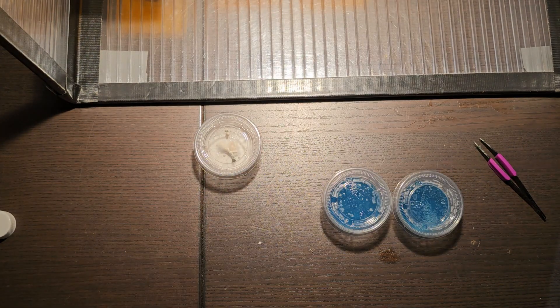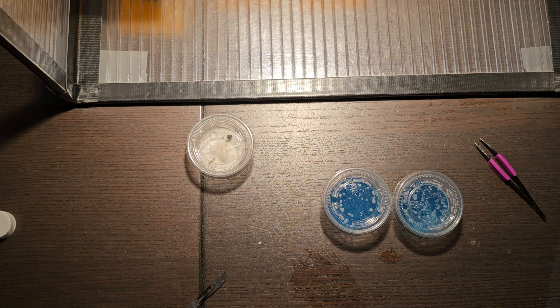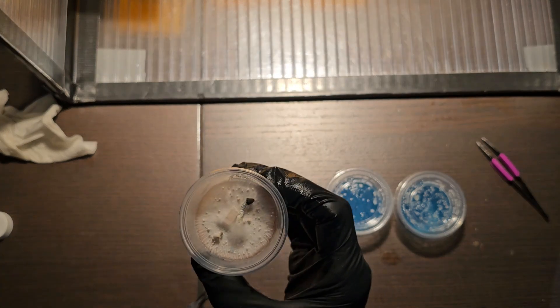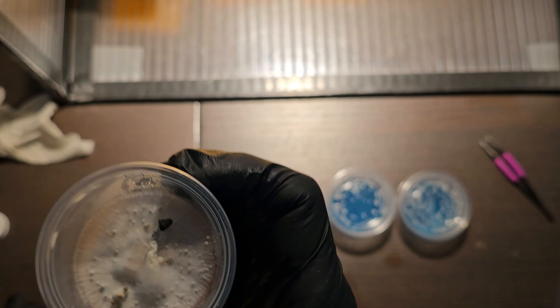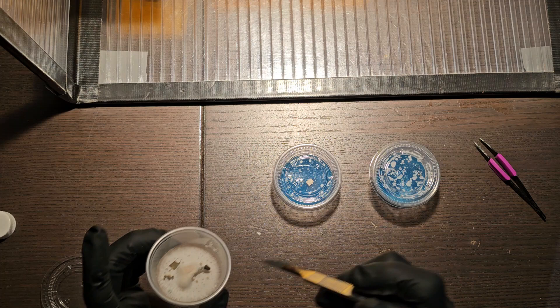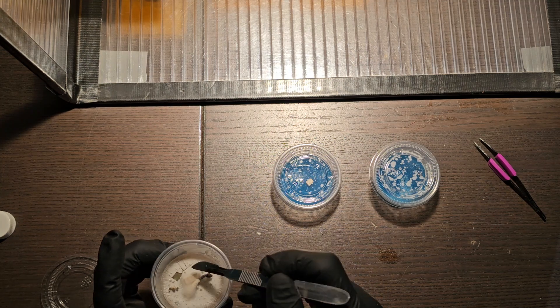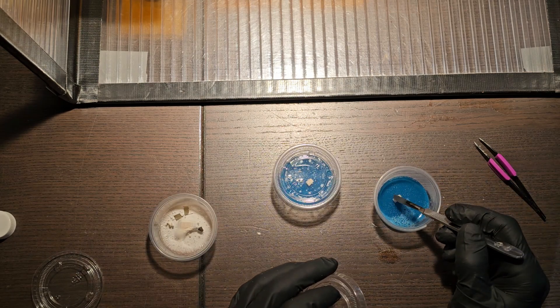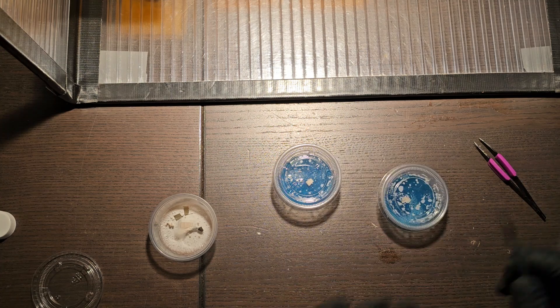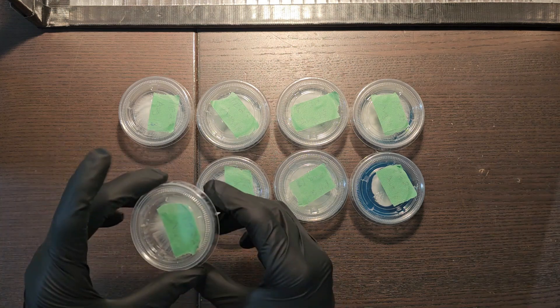For the last one I'll need my knife. This agar has been sitting around since June 21st — almost two months. I really haven't been on top of much lately, but I'm trying to get back into it. You can see this one actually grew a mushroom right inside the cup. There are a bunch of little nodules that have formed on the surface, so I'm trying to cut out a couple pieces that don't have any of that attached.